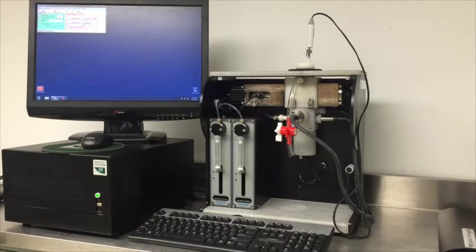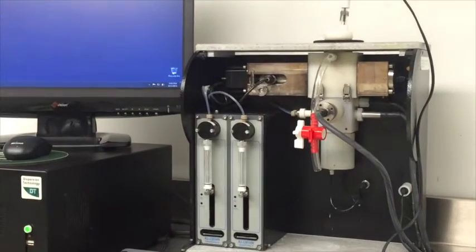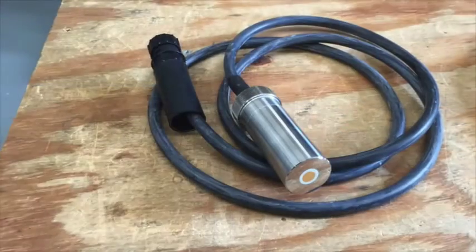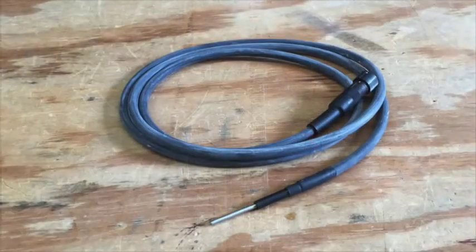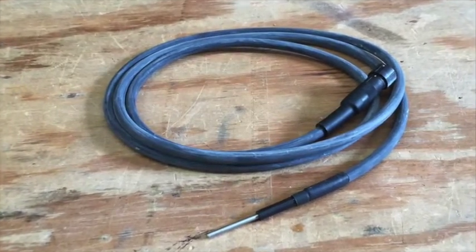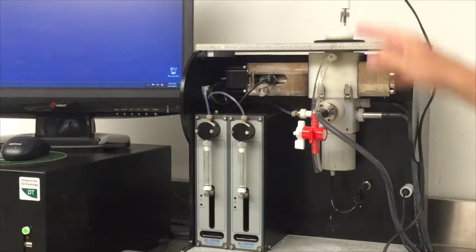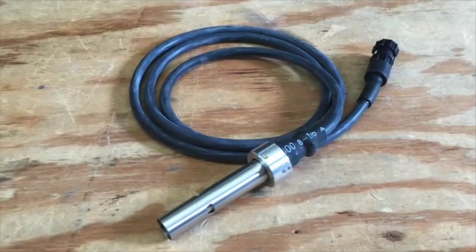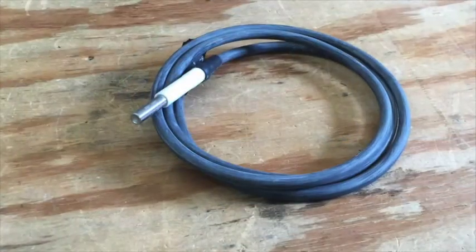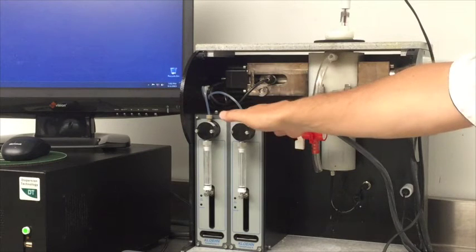The set of probes includes acoustic sensor for particle sizing and high-frequency longitudinal rheology, zeta potential probe, temperature probe, pH probe, conductivity probe aqueous, conductivity probe non-aqueous, heater probe, and burettes for titration.